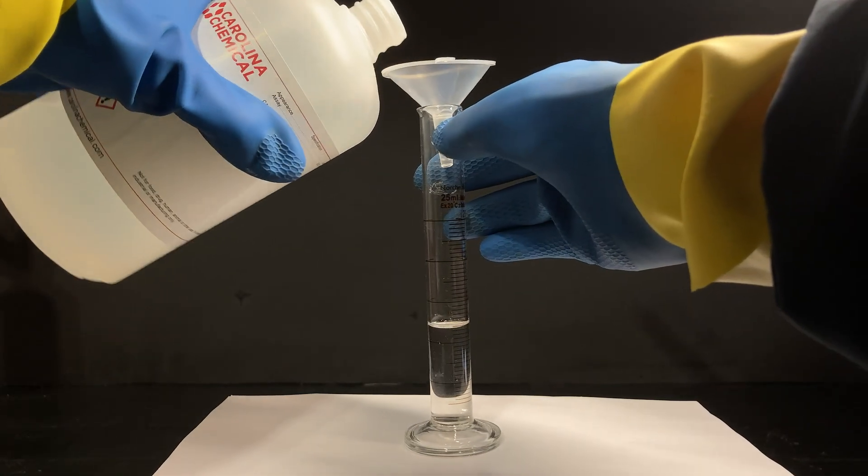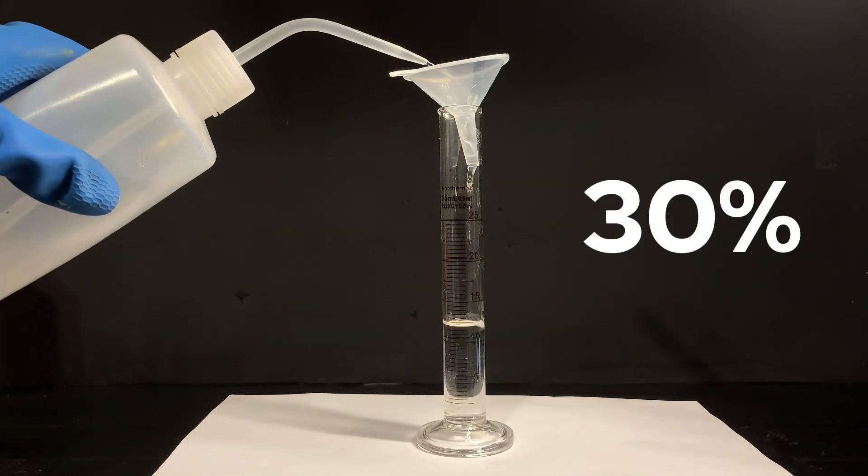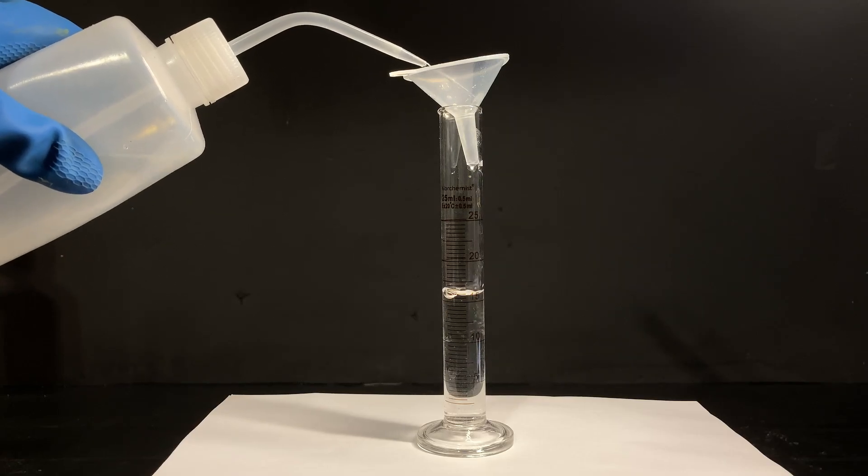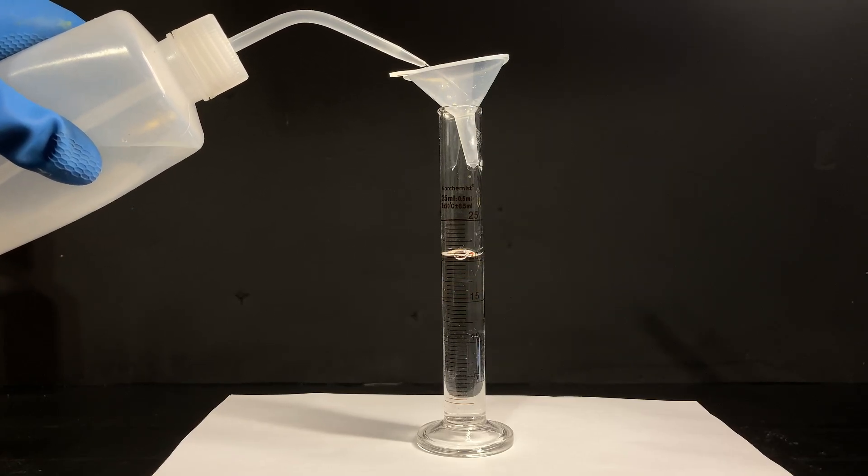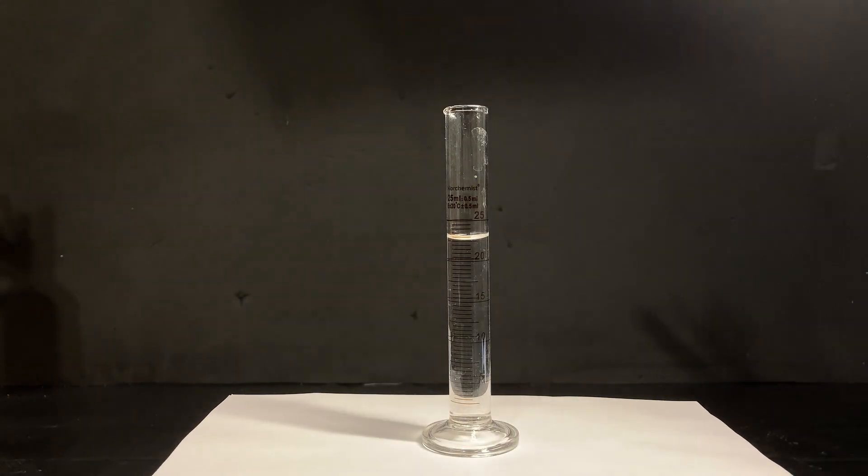Now, I carefully poured in some 50% hydrogen peroxide into a graduated cylinder and diluted it to 30%. It is important to never use hydrogen peroxide that is too concentrated, as the reaction when we mix it with sulfuric acid is extremely exothermic.